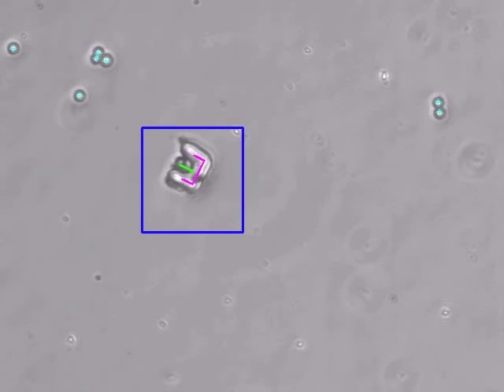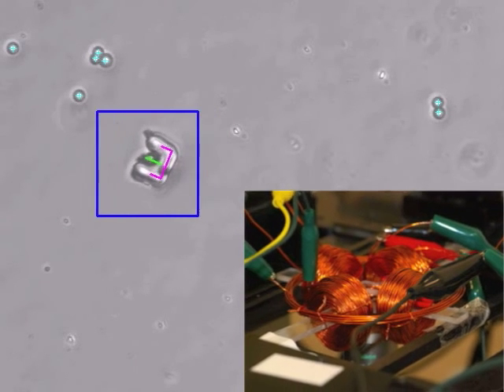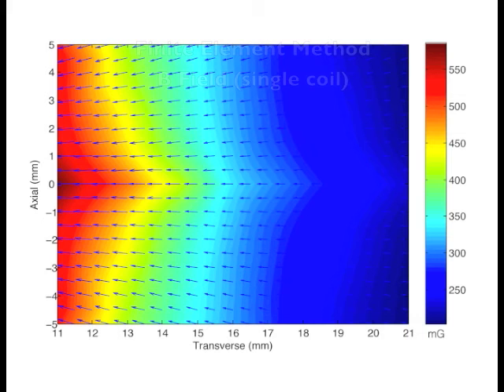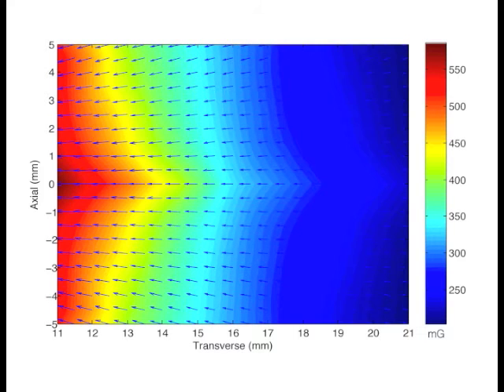The microrobots are actuated using a set of coils integrated with the microscope stage. Despite the relatively close proximity of the electromagnetic coils, it has been experimentally determined that the cores have little effect on one another in terms of magnetic field in the workspace, and that an assumption of linear superposition is reasonable.